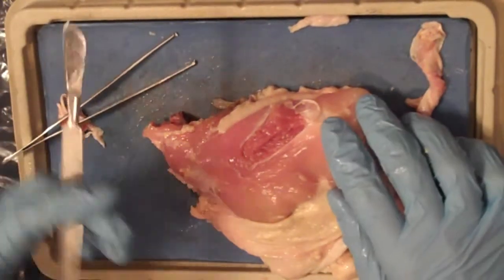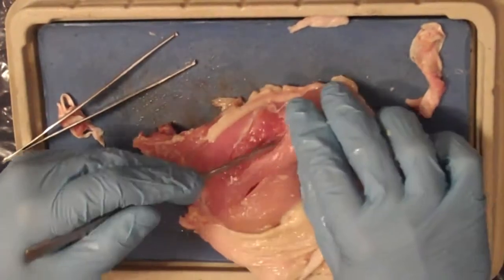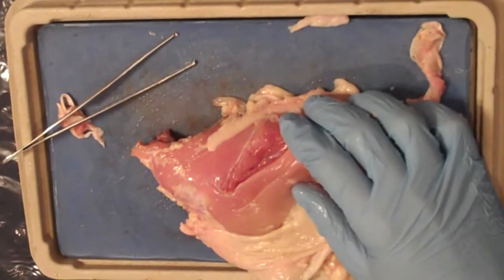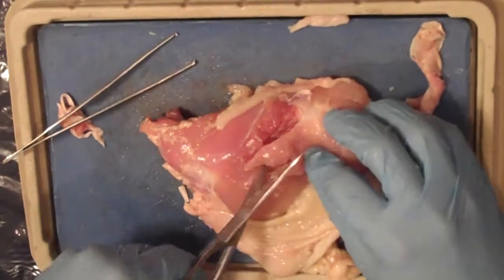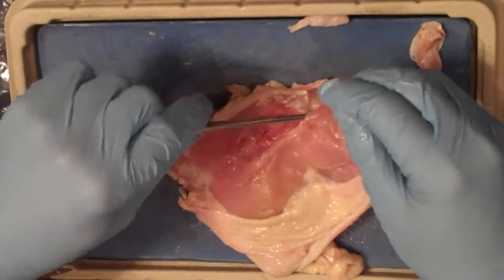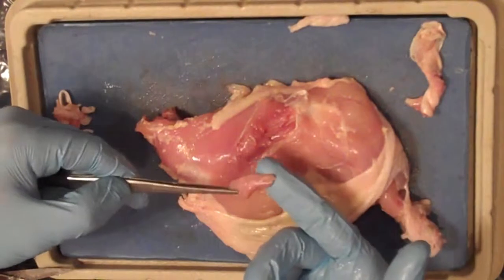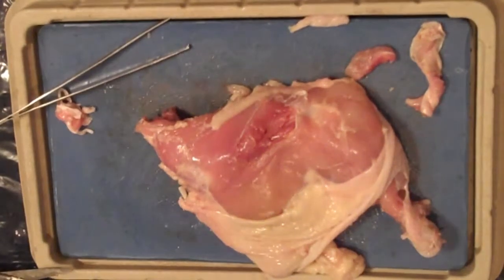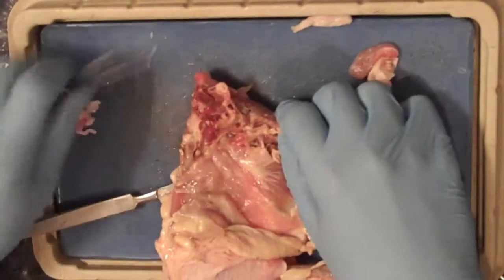Finally, the tissue that's in largest quantity, and the tissue that you like to eat, is the muscle tissue. In this case, we're looking at skeletal muscle. If you remember, skeletal muscle functions in voluntary function. Since the legs are a strong muscle in the chicken's body, the skeletal muscle tissue is very thick here. Remember, it's made of long, thick fibers that are flexible and stretchy, yet they can contract and release. So cut a piece of the skeletal muscle tissue so you can view it under the microscope. If you look even further, you can find a small piece of the kidney that's found right near the thigh.